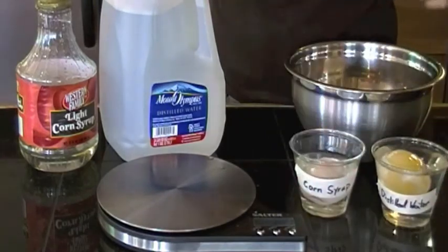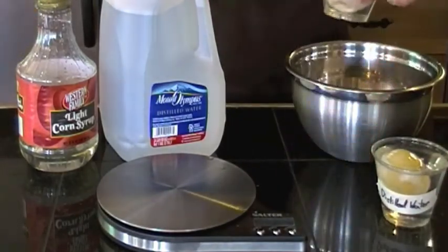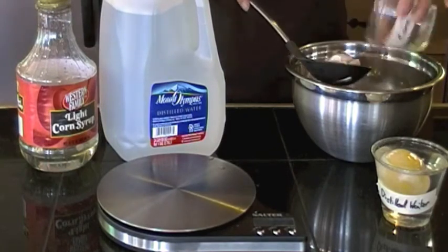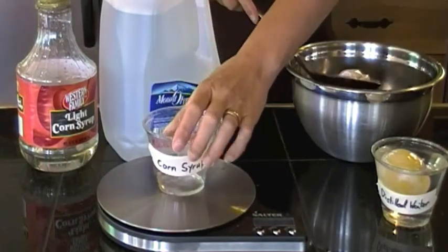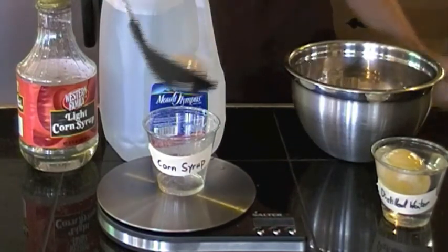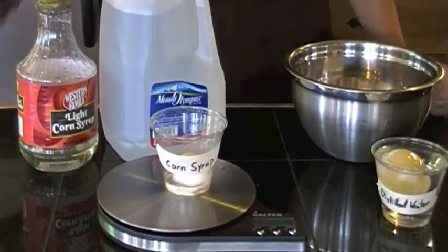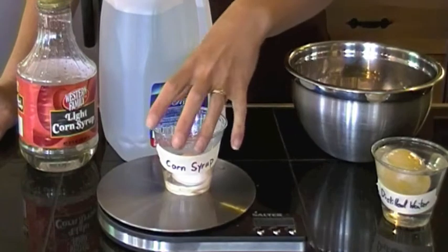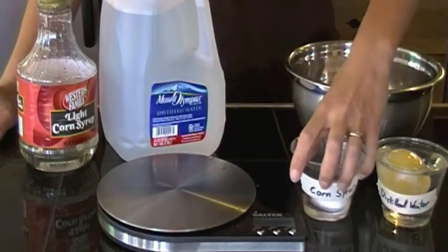Let's measure this quantitatively using the same methods we've used in the last part of our lab. I want to remove the liquid from our corn syrup egg. I'm going to tare the container, and then I'm going to return the egg to its original container. We see that the final mass is now 48 grams, quite a bit less than it was initially.